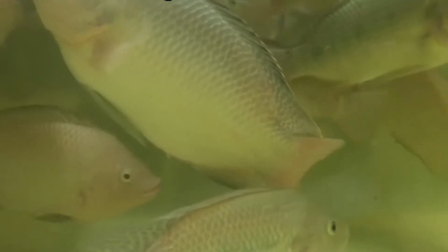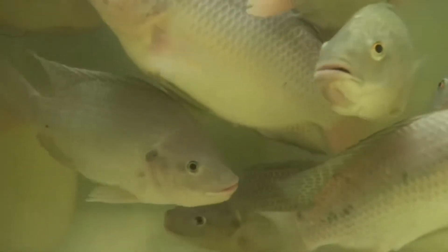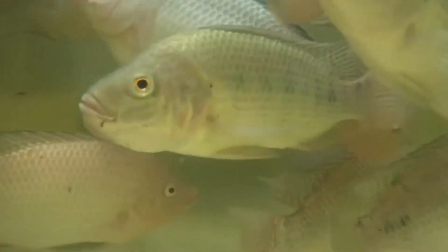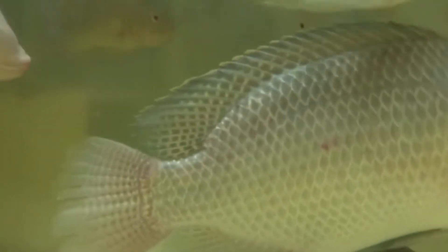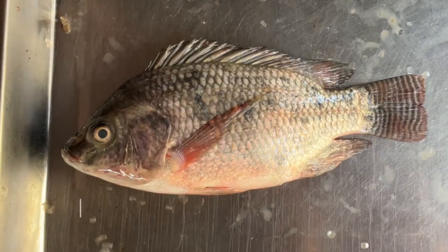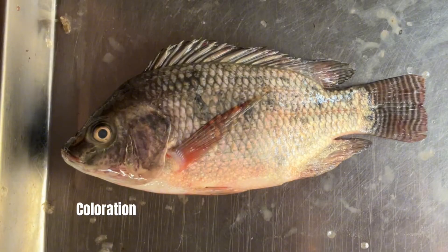The movement of a fish's mouth can vary depending on the species and its feeding habits. The way the mandible and the maxilla move as the fish opens and closes its mouth might change. Fish possess a maxilla which remains relatively fixed as the mouth opens and closes, while the mandible can move forward and downward to open the mouth, enabling it to swallow water or catch prey. The coloration and patterns of tilapia play a role in camouflage, communication, and mate attraction.